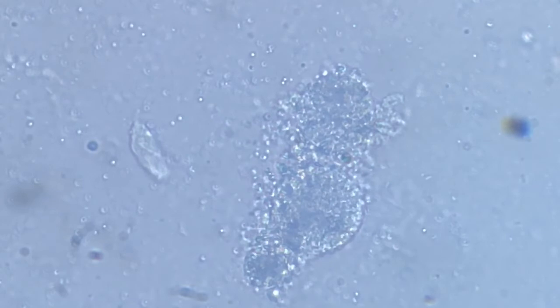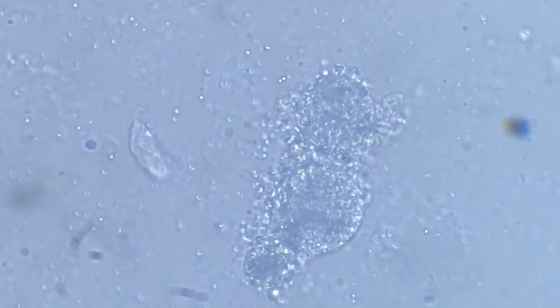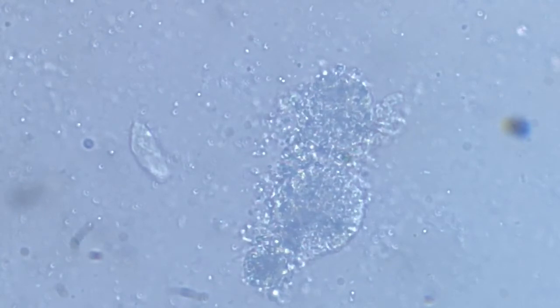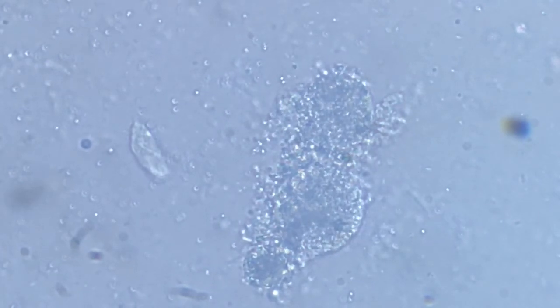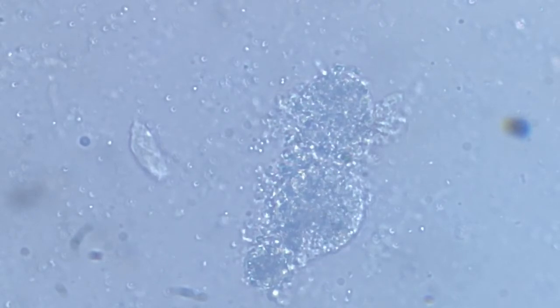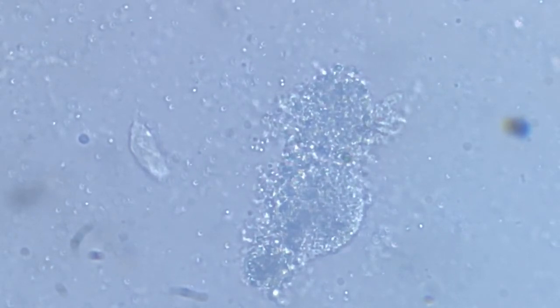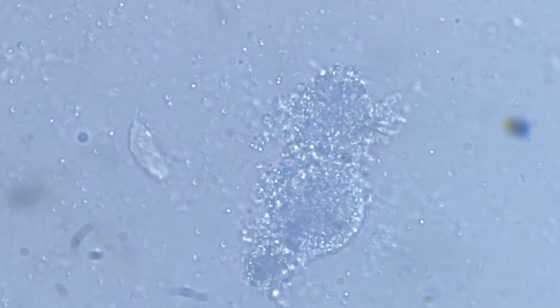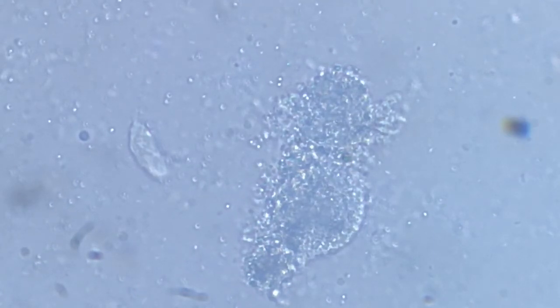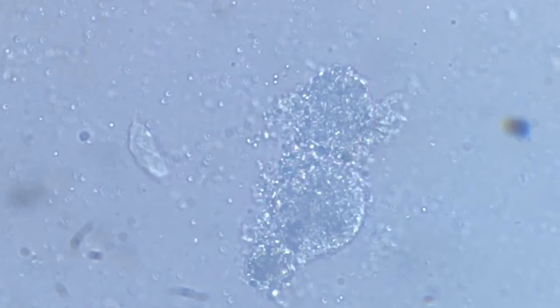That is the end of existence of this life form. This protoplasm will now serve as nutrition for other organisms, other microbes, and it shall go back to the earth, to the elements.